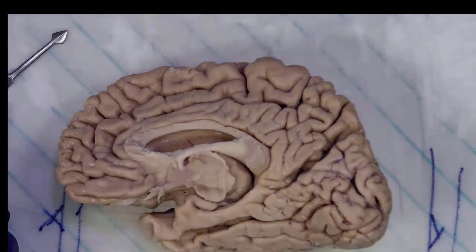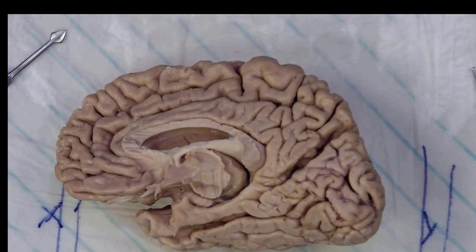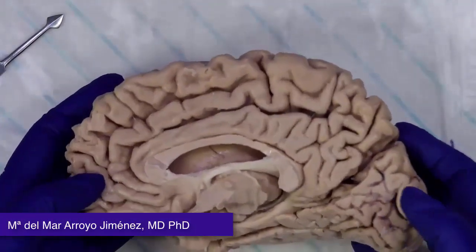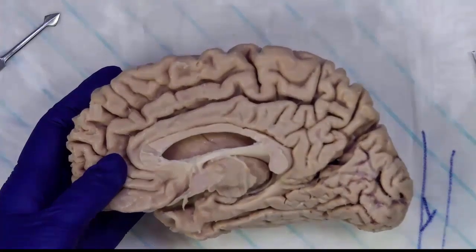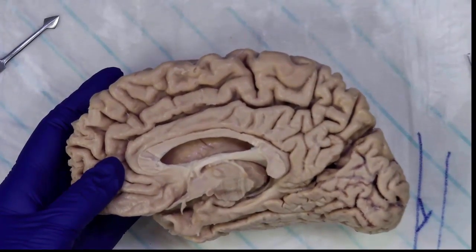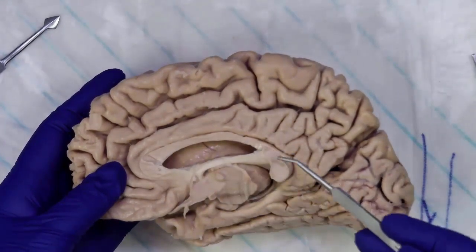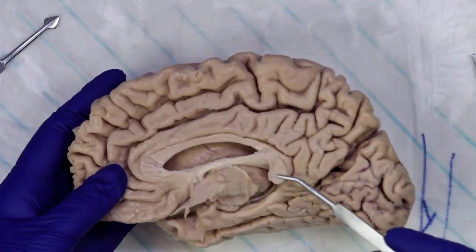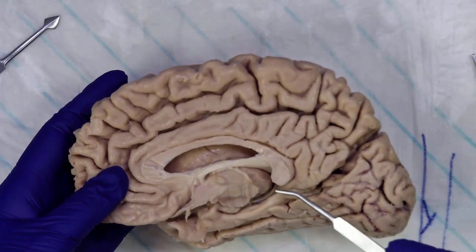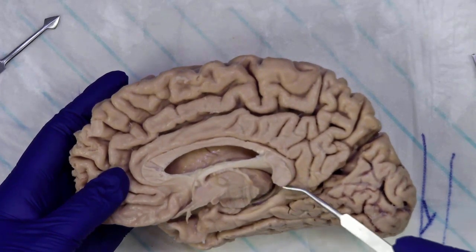We are now continuing with the isolation of the temporal lobe. If you remember, we have the half of the hemisphere, and we are taking account of some structures that we can identify clearly, such as the corpus callosum. This is the splenium of the corpus callosum, meaning this is the caudal part, which is close to the tail of the hippocampus, and also the back part of the parahippocampal gyrus.